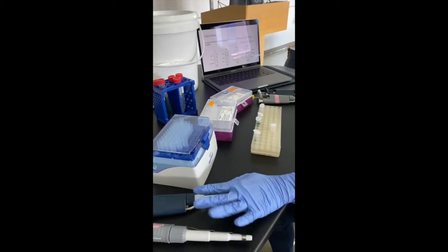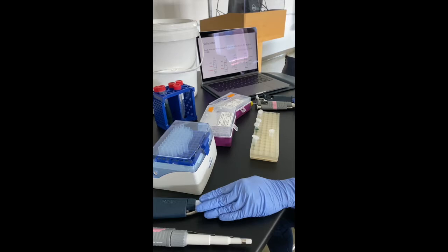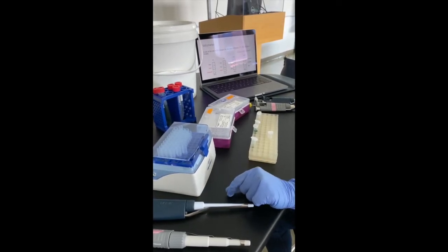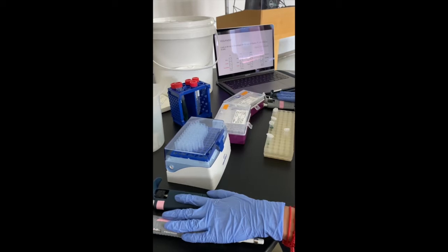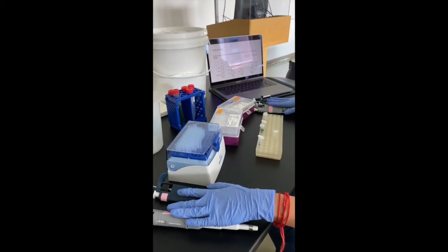Micropipettes are pipettes that you use to measure small volumes of a solution. Micropipettes can be used to measure a volume as small as 0.2 microliters to a volume as large as 1000 microliters, which is 1 milliliter. So these are the 4 micropipettes that are generally available in a lab setting. We are going to go with the basics of all of these 4 micropipettes.